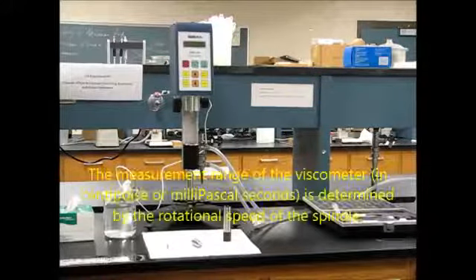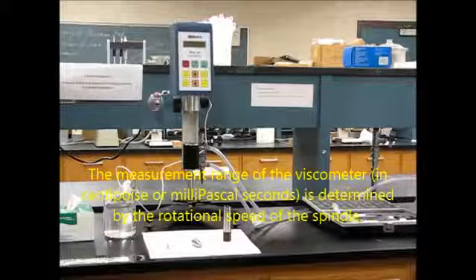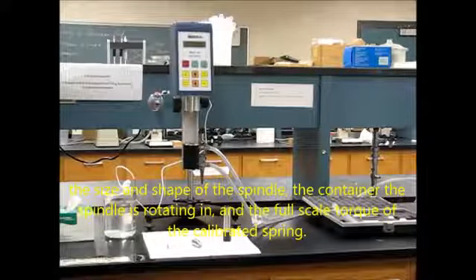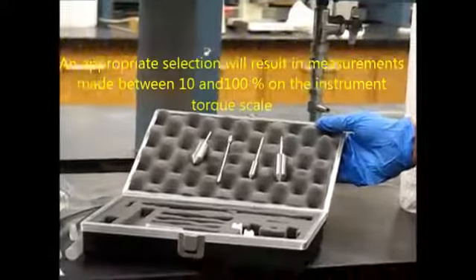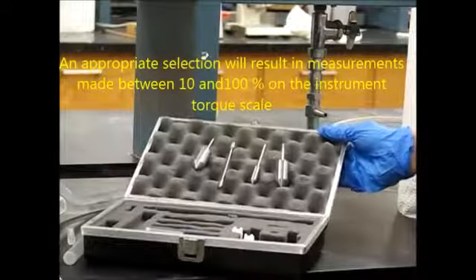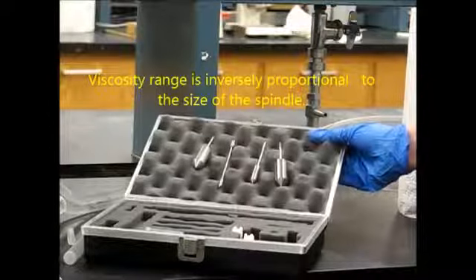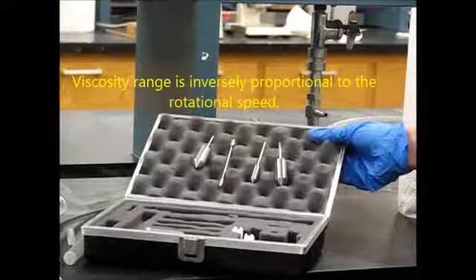The measurement range of the viscometer in centipoise, or millipascal seconds, is determined by the rotational speed of the spindle, the size and shape of the spindle, the container the spindle is rotating in, and the full-scale torque of the calibrated spring. Selecting a spindle is a trial and error process. An appropriate selection will result in measurements made between 10 and 100% on the instrument torque scale. These two general rules will help in the trial and error process. First, viscosity range is inversely proportional to the size of the spindle, and second, viscosity range is also inversely proportional to the rotational speed.